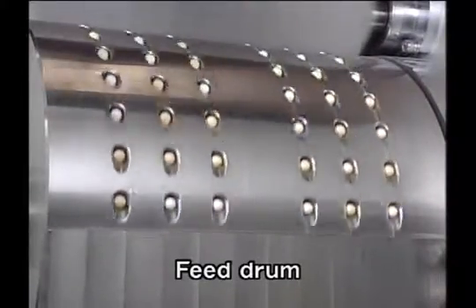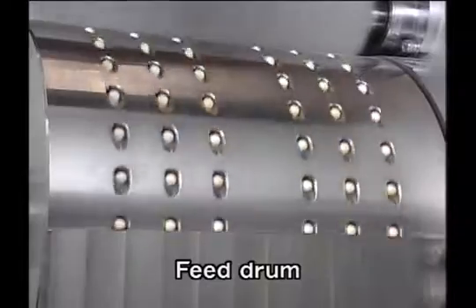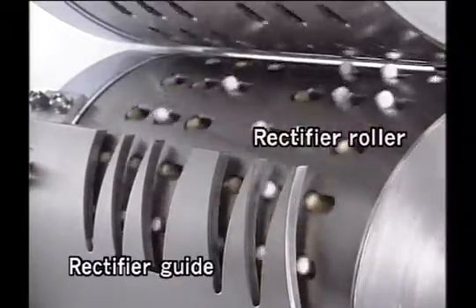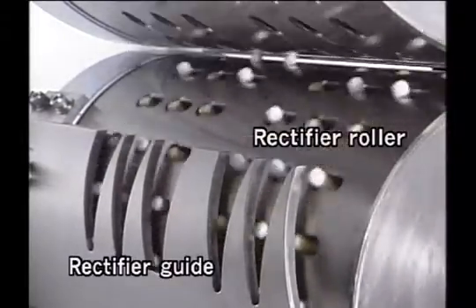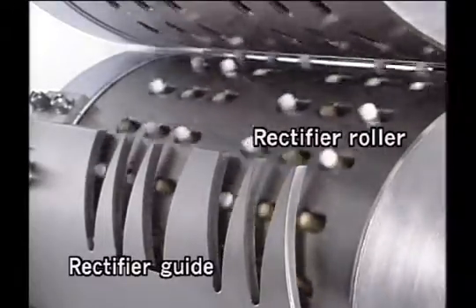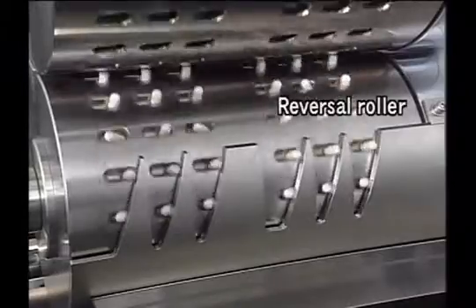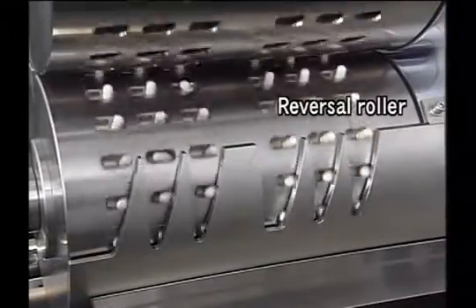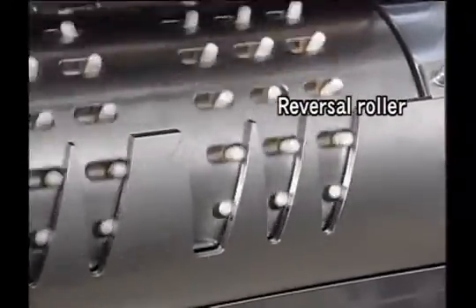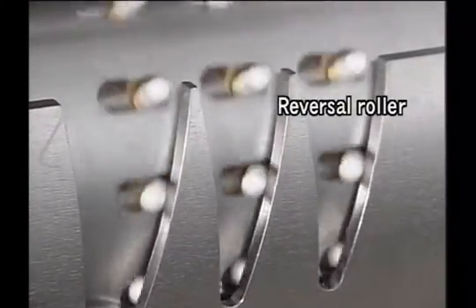Capsules that enter the hopper are fed into the supply drum. Then the next step is to feed these capsules into the rectifier roller. At this time, the direction of the capsules is regulated by the rectifier guide. After undergoing rectification, the capsules are moved to the inversion roller and transported to the inspection drum while being kept horizontal.